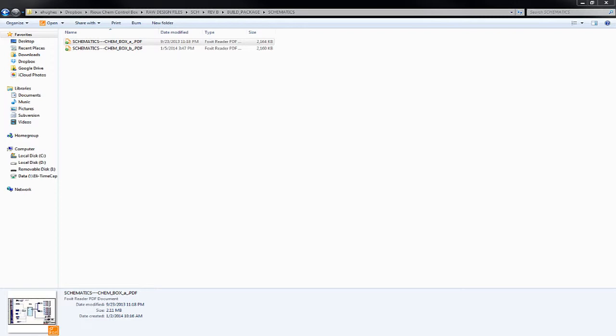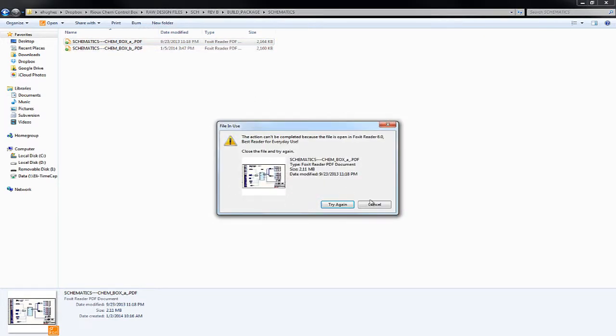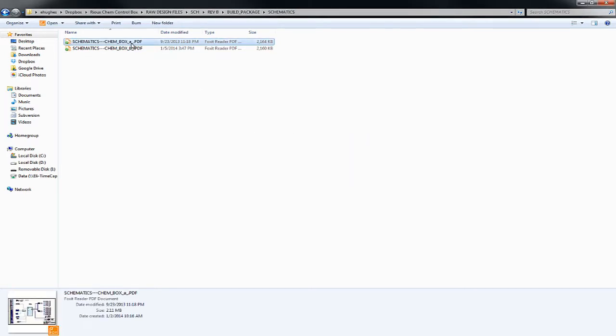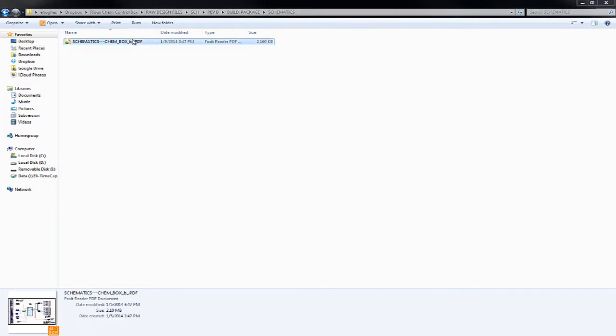I'm going to get rid of the old Rev A carryover. Sorry, I just want to get rid of the old version because it's near the folder. So you could look at this PDF file of these schematics.